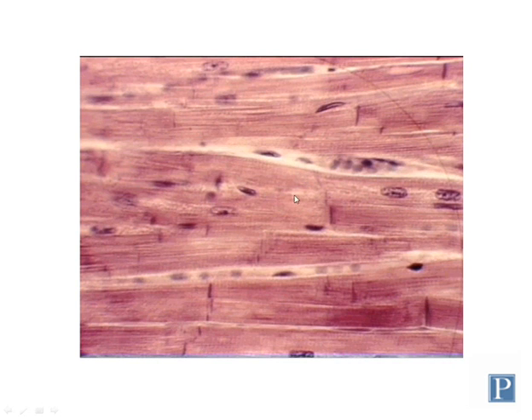Here is a high magnification view of the myocardium. You can see intercalated discs separating the cardiomyocytes, and this is a good place to find lots of blood vessels. You can see lots of capillaries and small blood vessels traveling along between these cardiomyocytes.